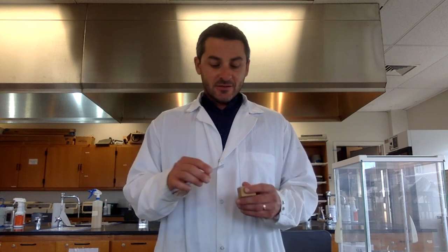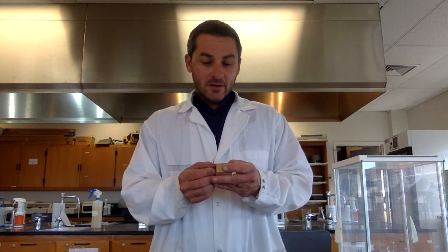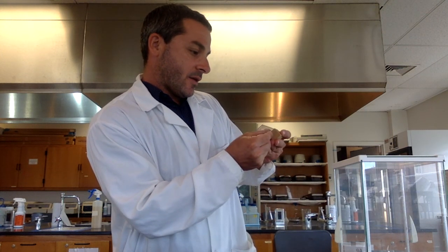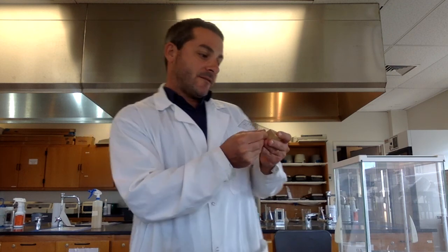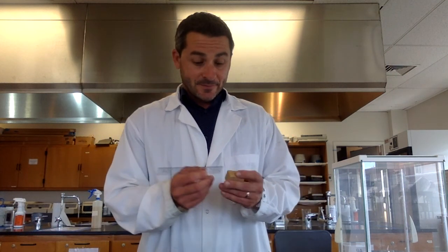The volume of a regular rectangle or a square is the length times the width times the height. So I'm going to measure all of these using the metric system because that's what we use in science. All right, so I'm taking this and I'm going to measure it in centimeters. So line up your ruler there, right? Measure it, and I get 3.7 centimeters for, we'll call that the width. So we write that down.